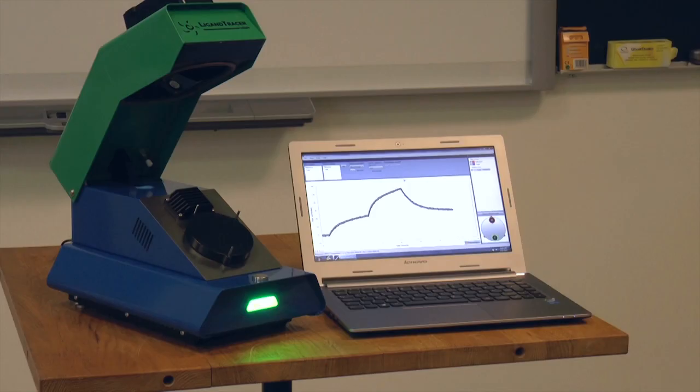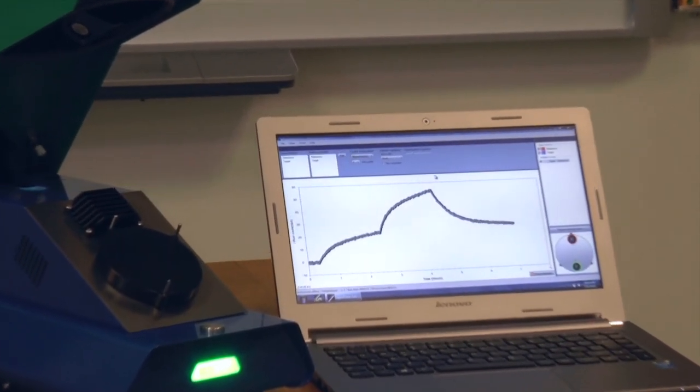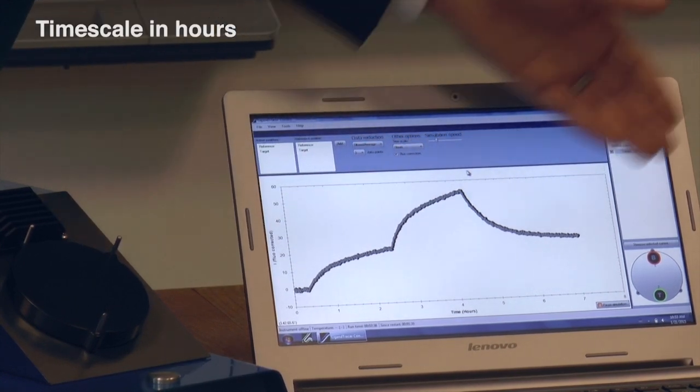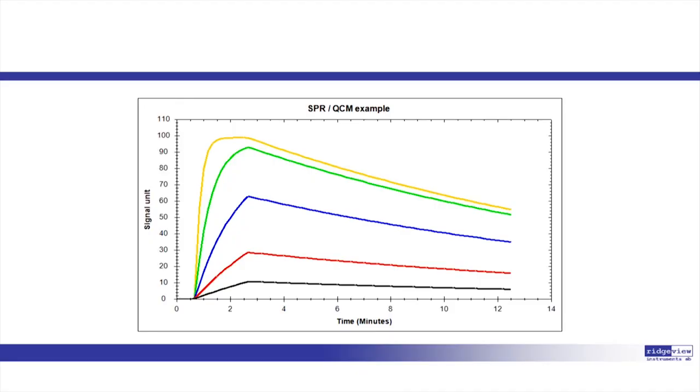I have exemplified the time-resolved interaction measurement using ligand tracer data, but everything I have said is general and applicable to other time-resolved methods. The approaches may differ a bit. With ligand tracer, we use few and low concentrations of ligand in sequence during long time. At low concentration, it simply takes time to see curvature. The typical SPR experiment instead uses several high concentrations, each during short times.